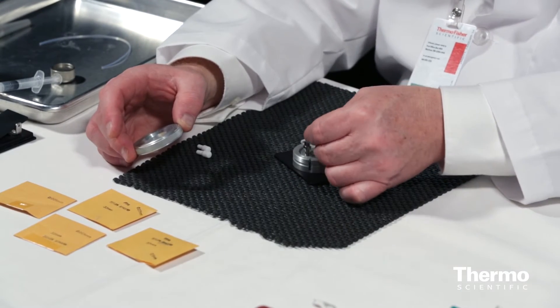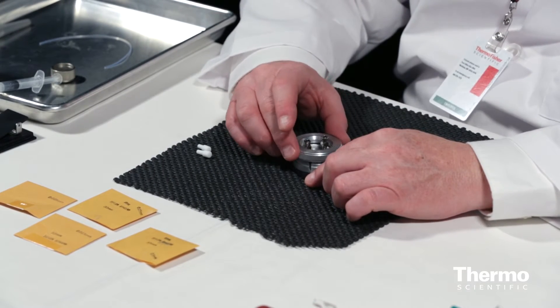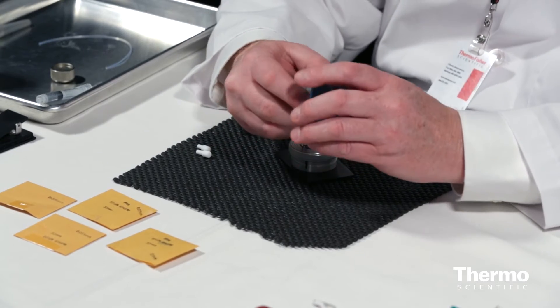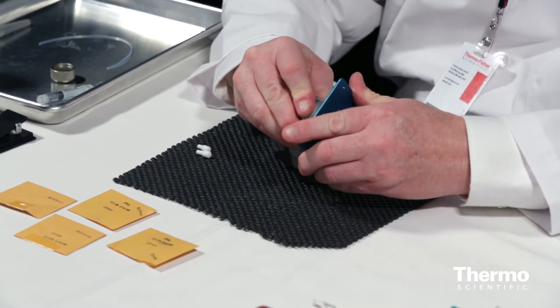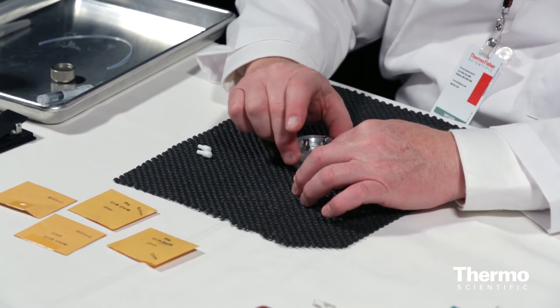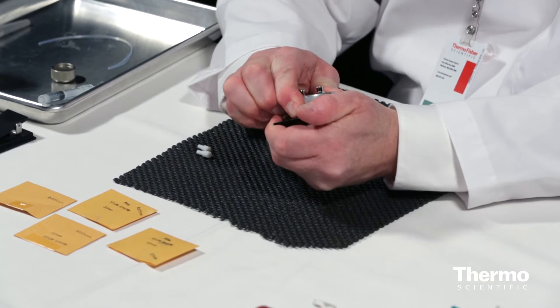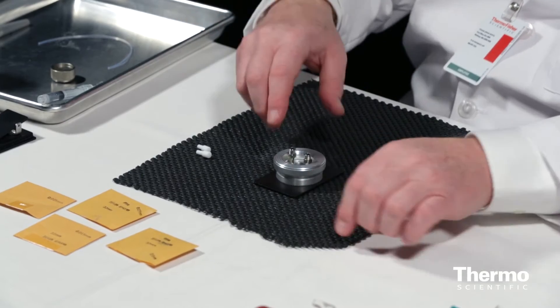I can pull the tubing out — it served its purpose and everything is lined up. To finish sealing the cell, I drop in the aluminum ring and the sealing ring. This is about the simplest push-assembly type. I screw it down finger-tight — if you over-tighten you can crush the windows, so don't use a wrench. Now the cell is ready to fill.